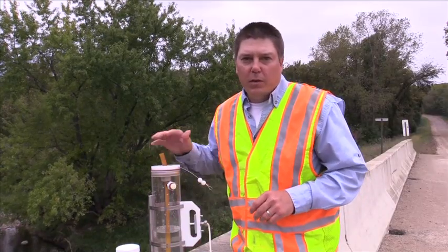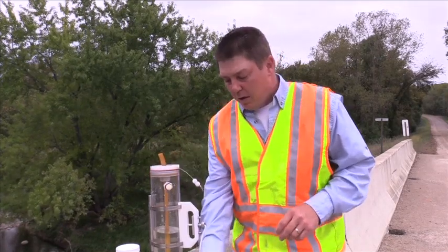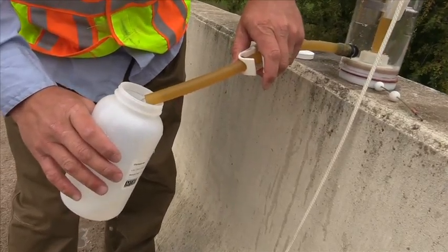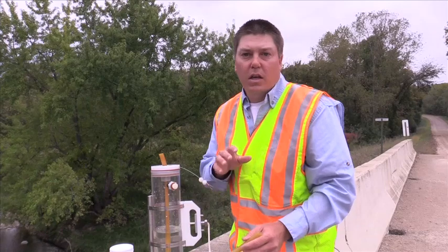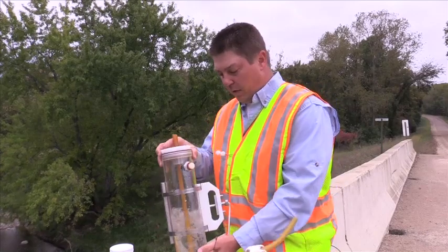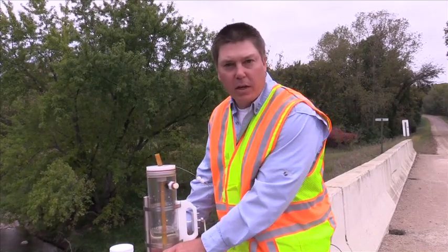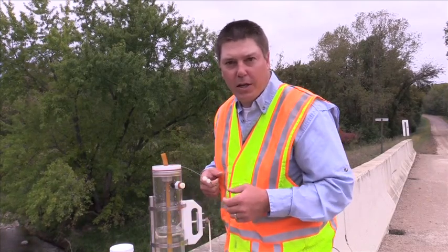There are a few key things to remember when taking a sample using the Van Dorn sampler. One is that you do not touch the rubber fill tube to the lip of the bottle when taking the sample. Another is that between filling water bottles, if you're filling more than one, give the sampler a little shake to agitate the sample. This eliminates sediment from settling out, allowing you to get a good representative sample.